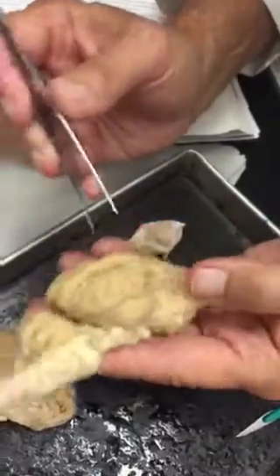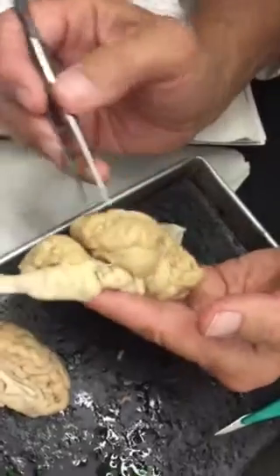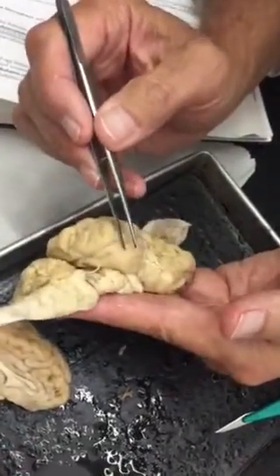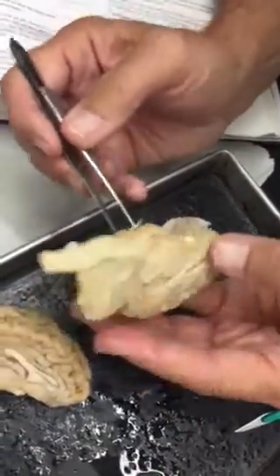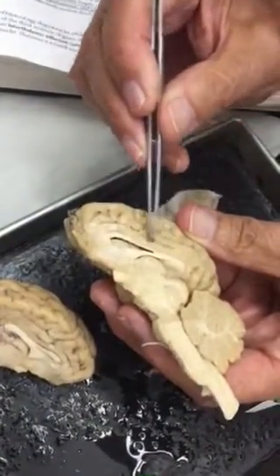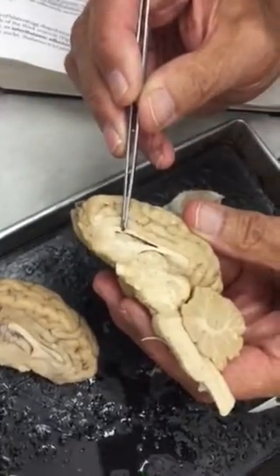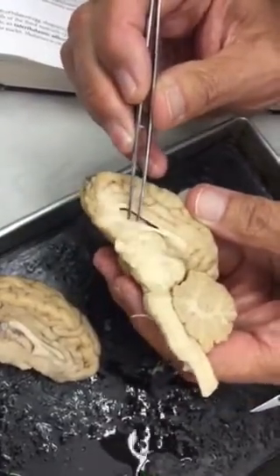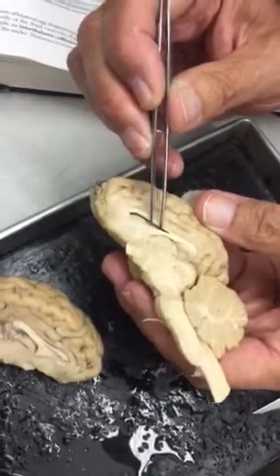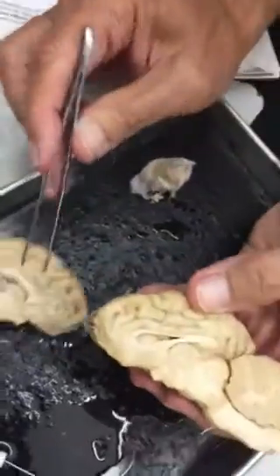Here's a cerebral fissure, and this would be the frontal, parietal, occipital, and temporal, right? Okay. Looking at a cross section, there's the cingulate gyrus along the top here, corpus callosum, and this is the which ventricle? Lateral. Lateral ventricle. There you go.